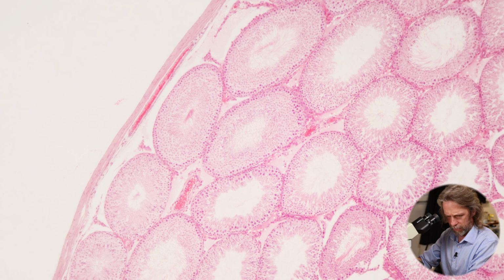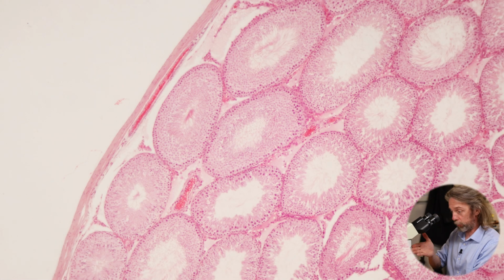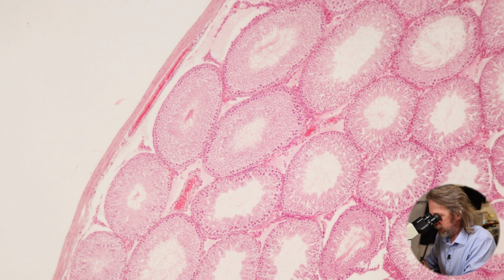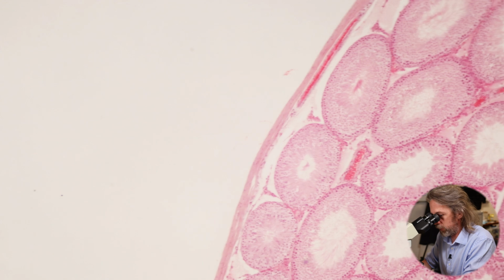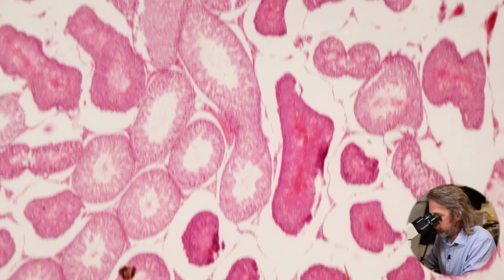Right, so zoom back out again. So this is my lowest power. This is a 4 times objective lens and 10 times magnification to my eyes, giving me a 40 times magnification. It'll be a little bit different to you depending upon the size of your screen. But what we see then, if we look at the testis, sure, we see that tunica albuginea on the outside, but if we look around, this is what the testis looks like.